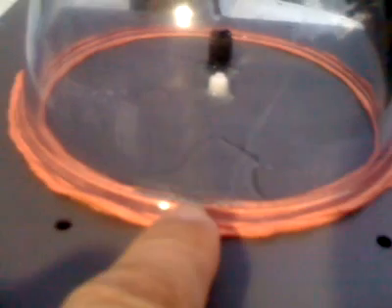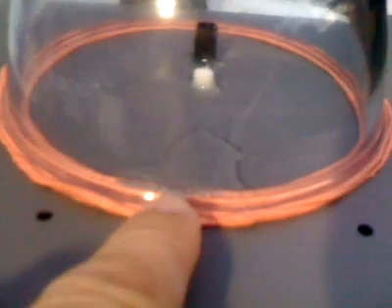And that's not bubbles because there's air leaking in, because we're still holding a vacuum. But that's bubbles because it's bubbling. The ambient temperature is probably about 15 degrees, so that's pretty impressive. I dare say if I added a little bit of heat underneath the metal plate here, it would boil very easily, possibly even just off the heat of my hand, but super simple.